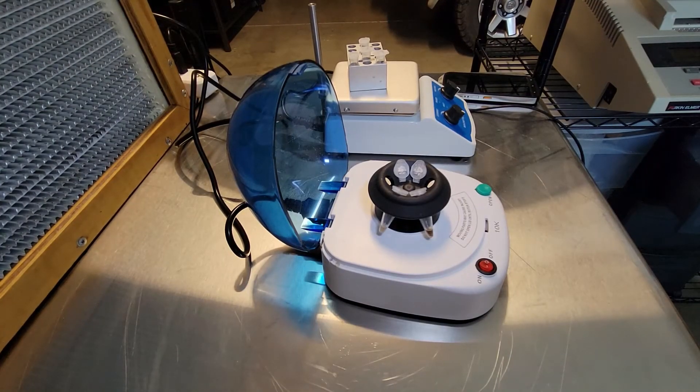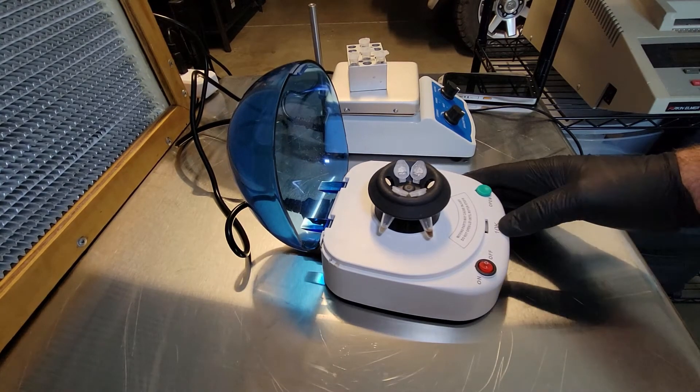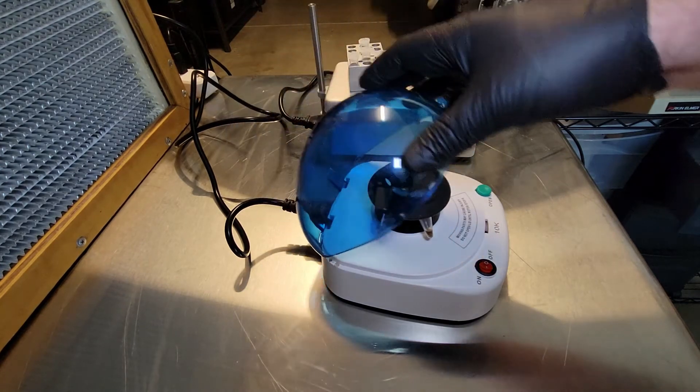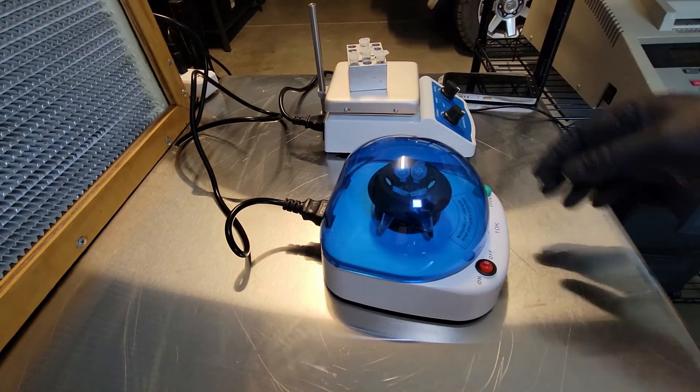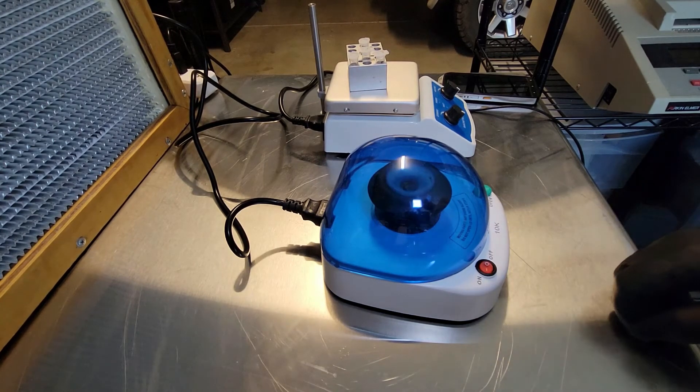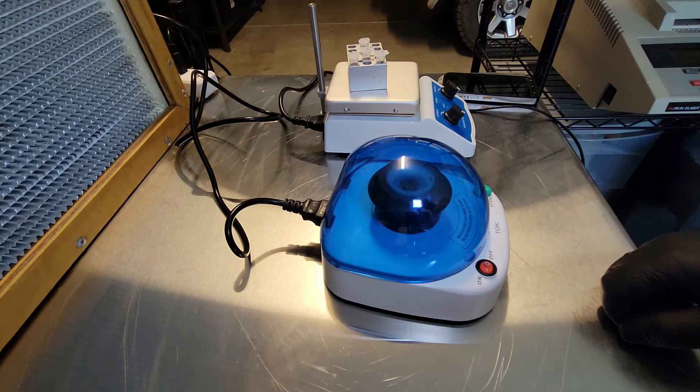The next step is I'm going to put my tubes into a centrifuge. That's just going to separate all the material down. This is, I would say, somewhat optional. It really does help get a nice clean solution going. I'll do this for about five minutes.